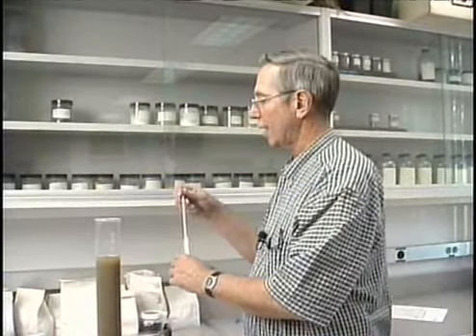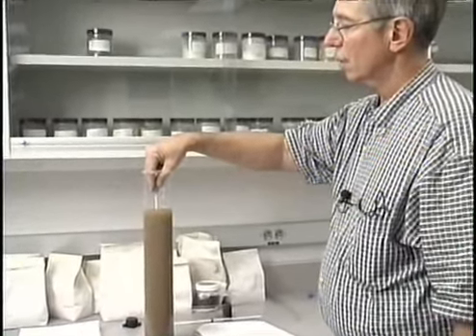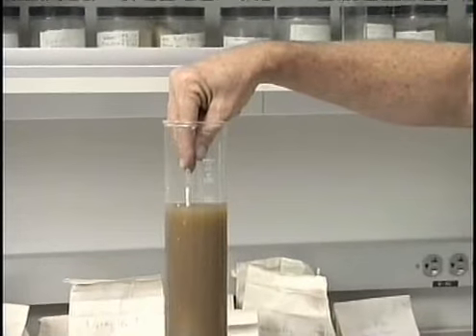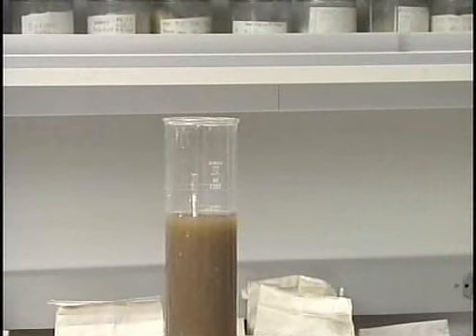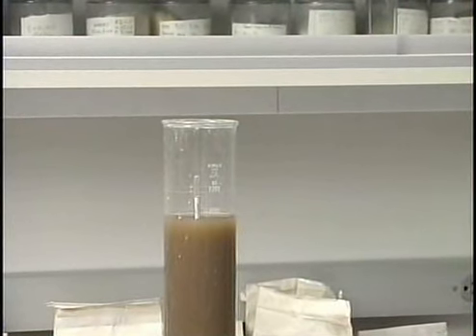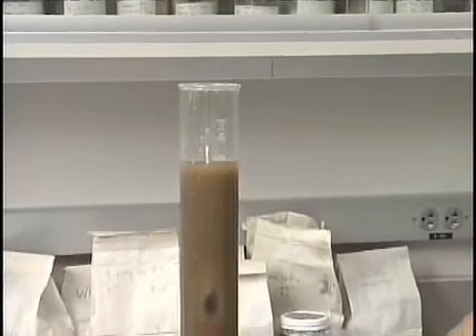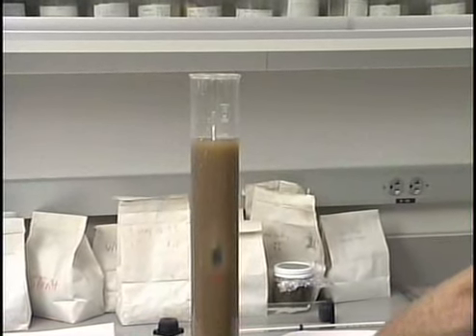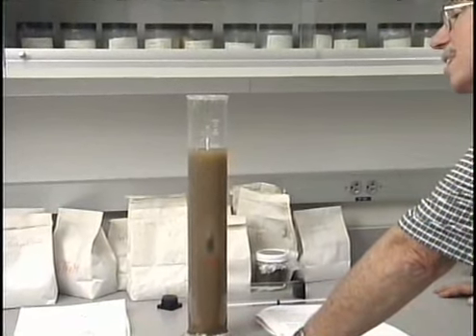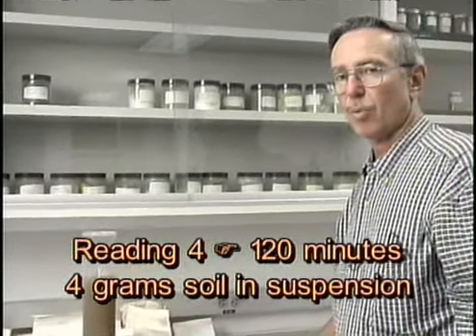take our 120-minute suspension reading. We basically let the hydrometer stop or stabilize. Reading the bottom of the meniscus, the hydrometer is reading right at 4. So what this is telling us is that there are still 4 grams of soil remaining suspended in the cylinder at this point in time.